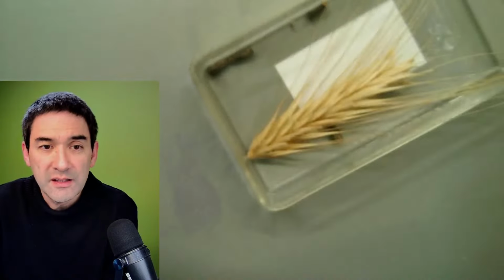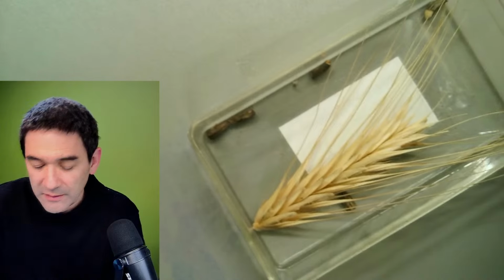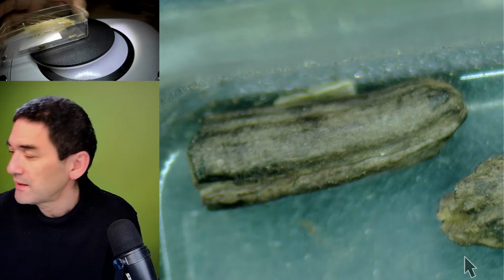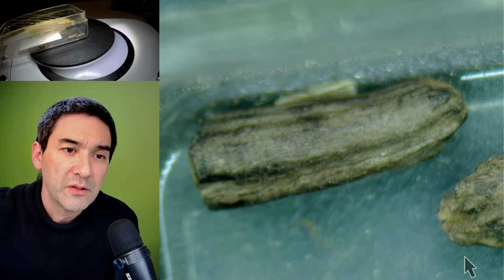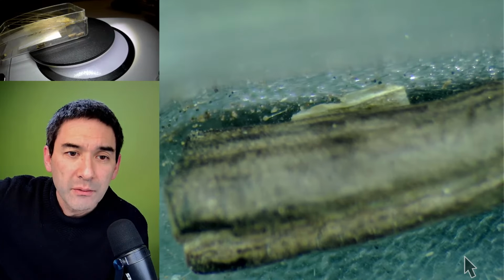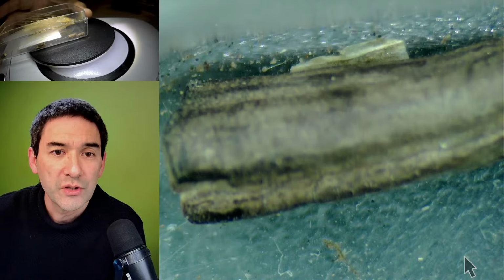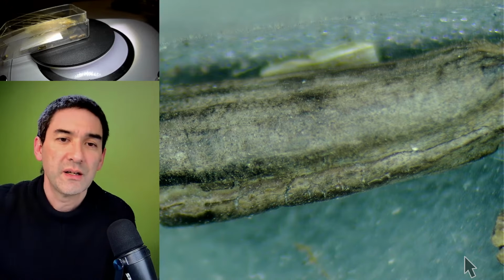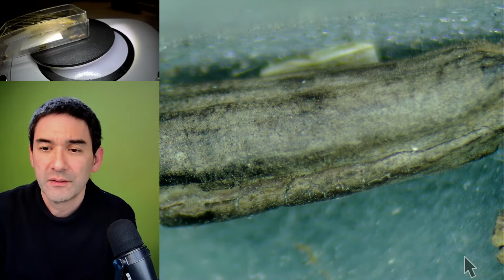And nowadays these things are of course all removed, and everything's checked. But this is a fungus, and here it is, it looks like this. So this basically is the fungus itself. It looks almost like one of the grains, but actually it is the fungal structure itself, and this produces a pretty strong alkaloid.